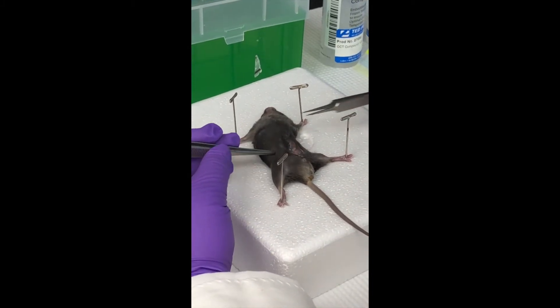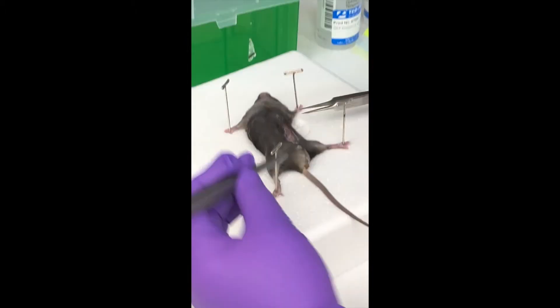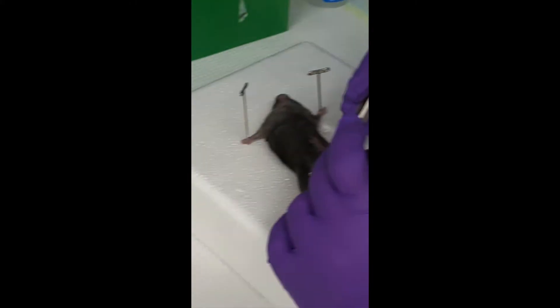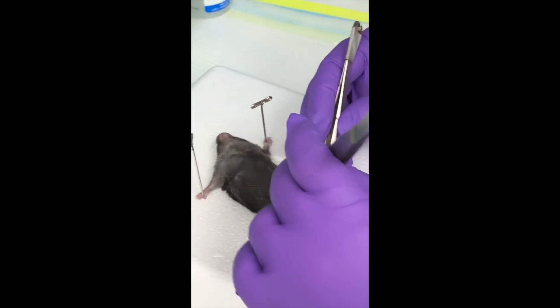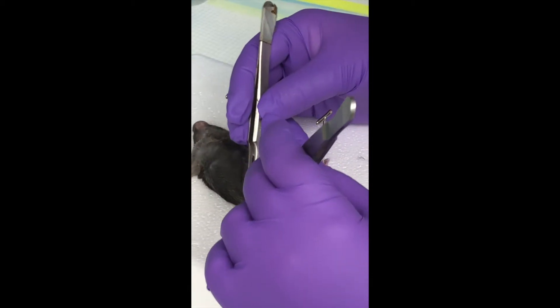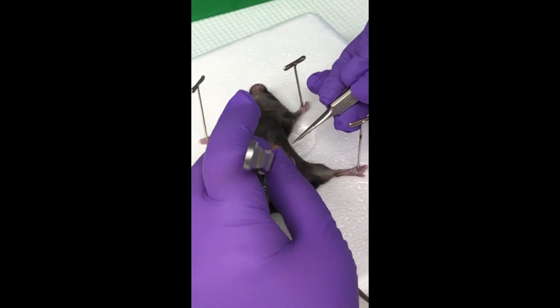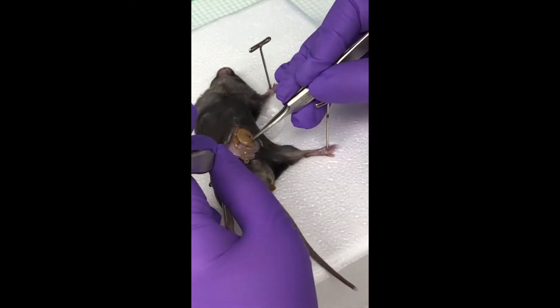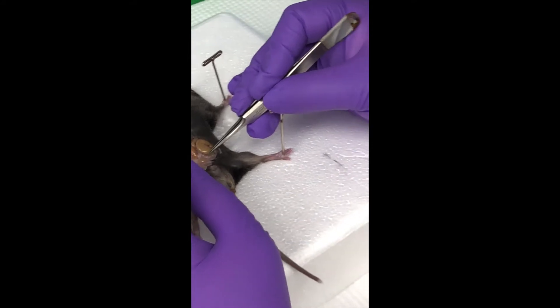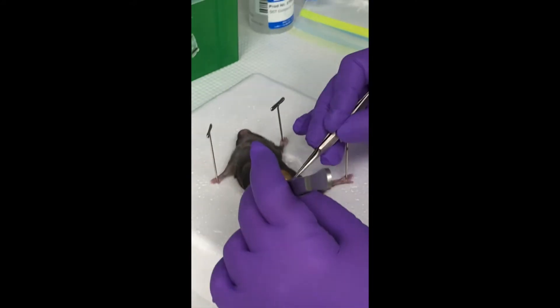I want you to get a screenshot or a picture of the fact that it's a vertical cut there. So what I want you to see now is the part where I'm going to... let's see the bladder — you can't see it. So you see that right there? Get another picture. That right there — that's the bladder.